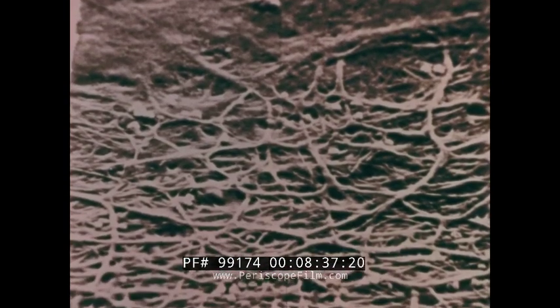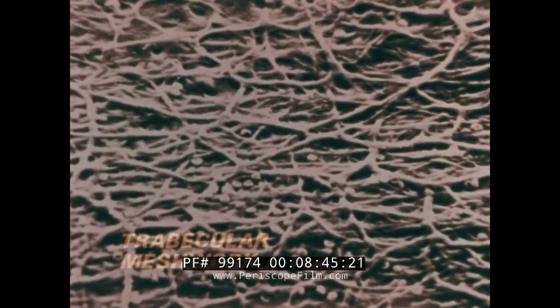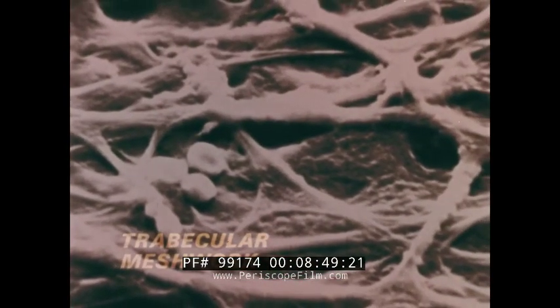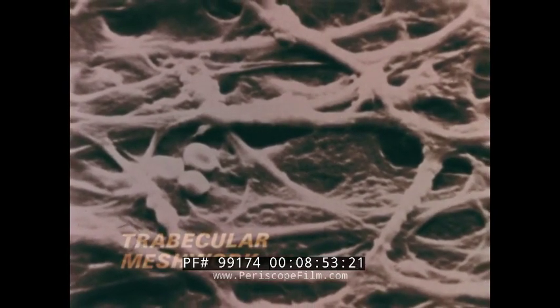Deep in the ocular structure of the human is the trabecular meshwork, the complex filter through which the aqueous humor flows. Allowing for the effects of preparation, we can see the network of collagen fibers and the thin cells stretched between them.